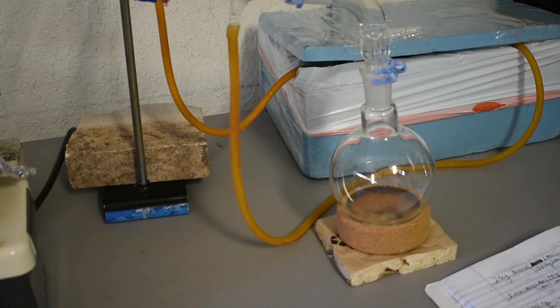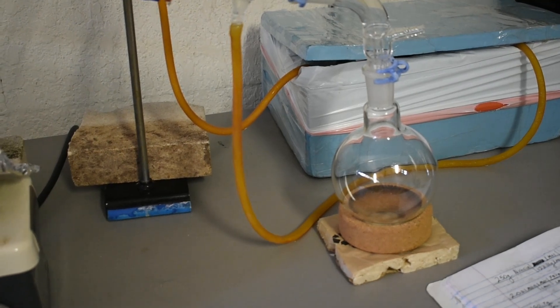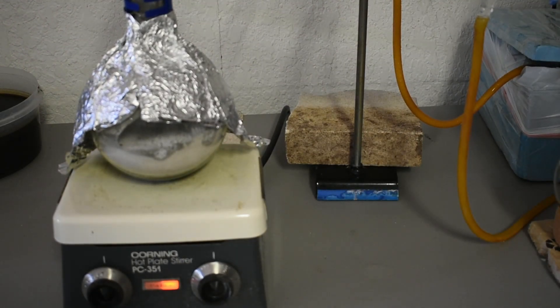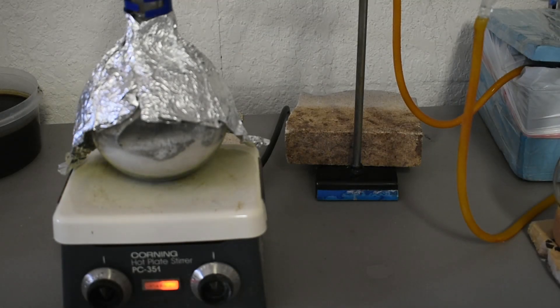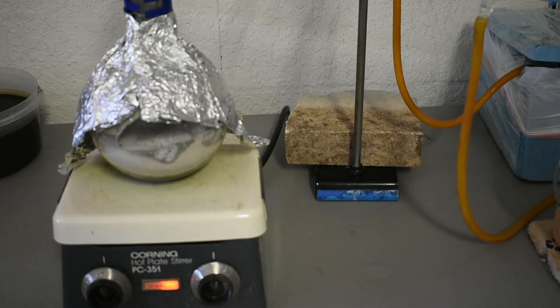Just for fun, I thought, this is my first time working with pyridine. I've never smelled it before. It has a pretty bad reputation, smell-wise. I'm going to put my nose up to that vacuum adapter and see what happens. This is my first time smelling pyridine. Oh. It definitely deserves that bad reputation. Wow. It's a very sharp smell. It does smell like rotting garbage. Not enjoyable at all. Definitely want to do this in a well-ventilated area.